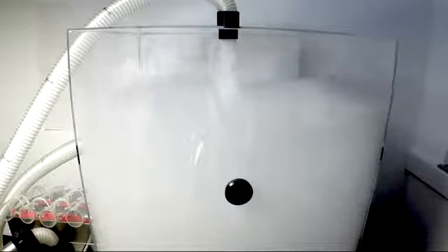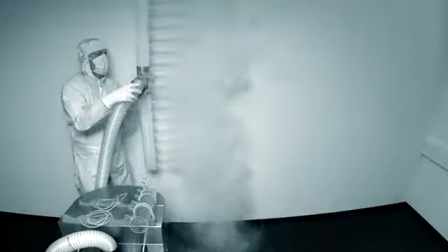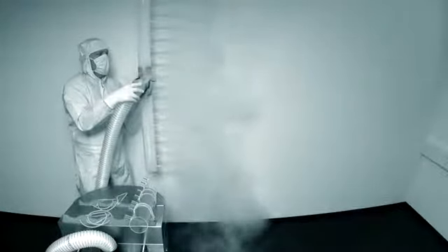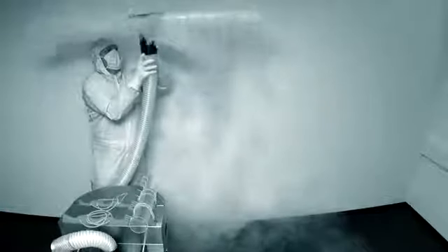Cleanroom and pharmaceutical managers know their application requirements, but some fogger manufacturers do not mention fog volumes, densities, visual distances, or control of their equipment. But it's important to know the performance details so the equipment under consideration can indeed accomplish the airflow test requirements.